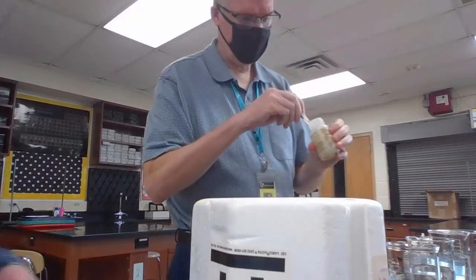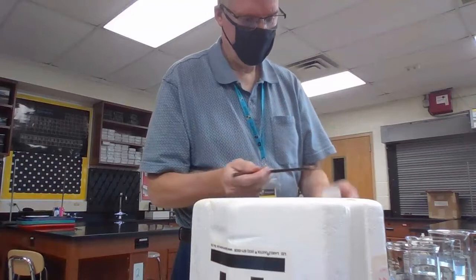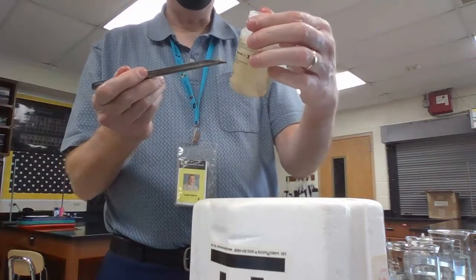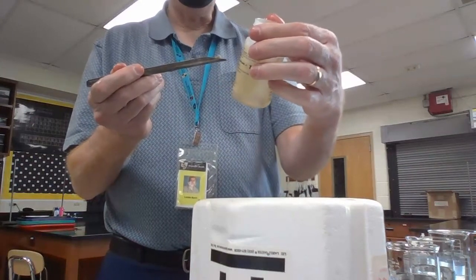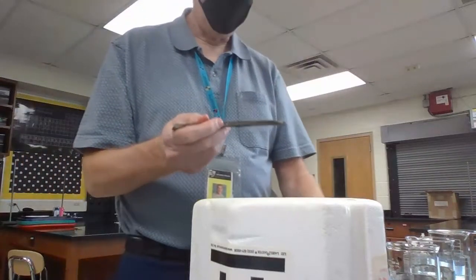So write down the observations, whatever you saw in the beaker. All right, what are we looking at now, Mr. Man? All right, the next one is, I got my container here of sodium. And again, it says metal lumps packed in mineral oil, flammable, corrosive, solid, dangerous when exposed to heat or flame, dangerous by reaction with moist air, water, spontaneously flammable. So again, a lot of the same warnings we had from before.